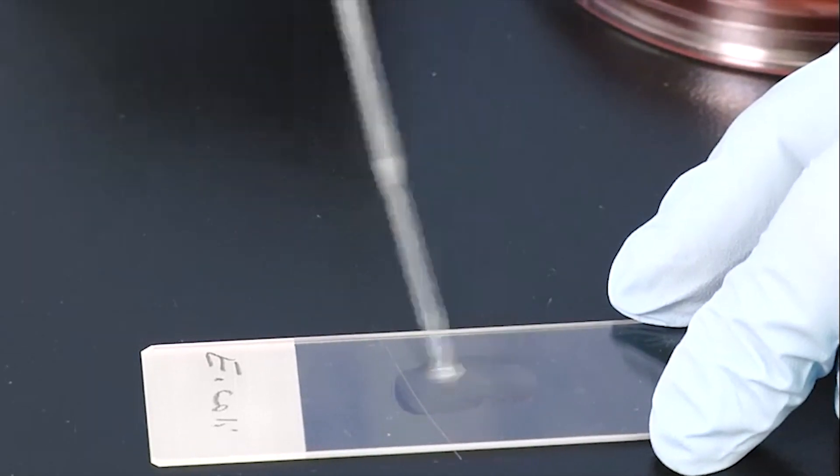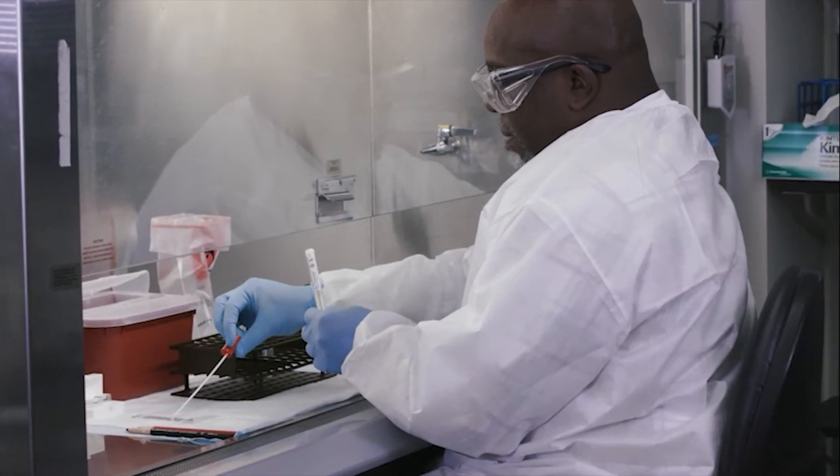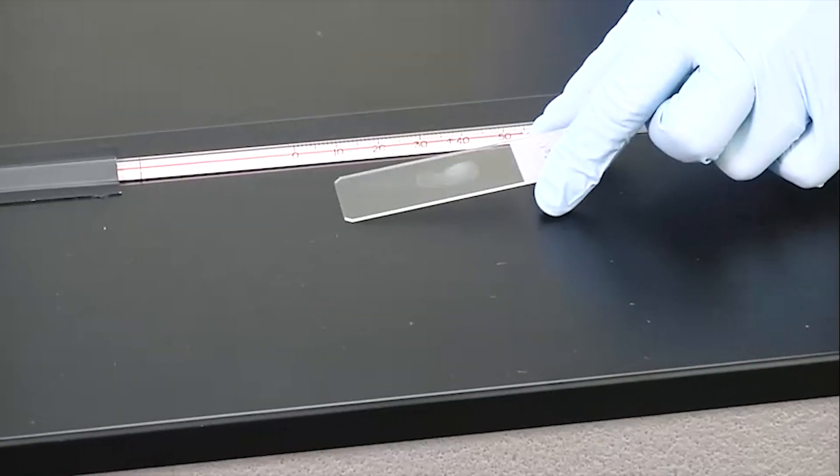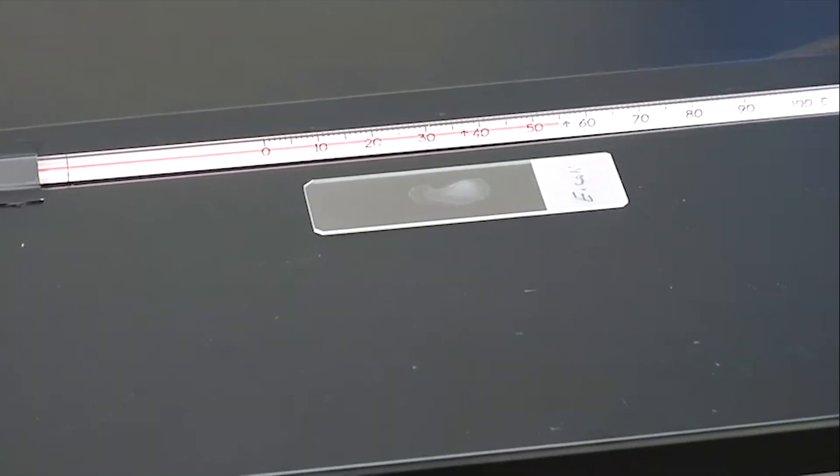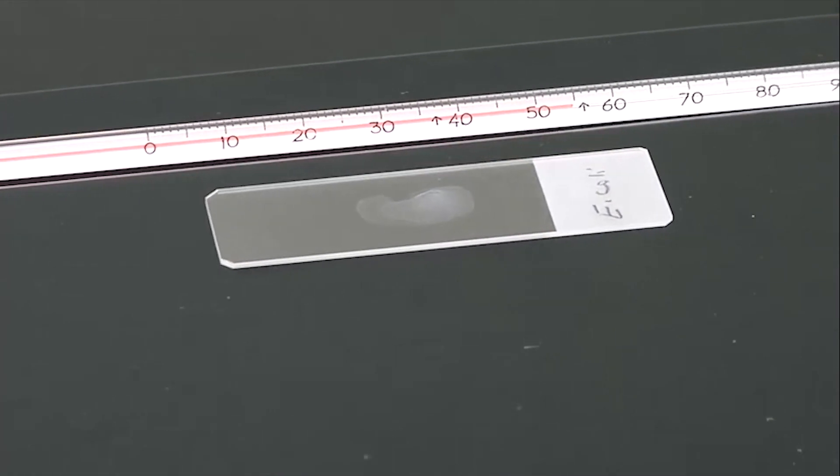During this process, avoid aerosols if possible. Again, let the slide dry or put it on a slide warmer.